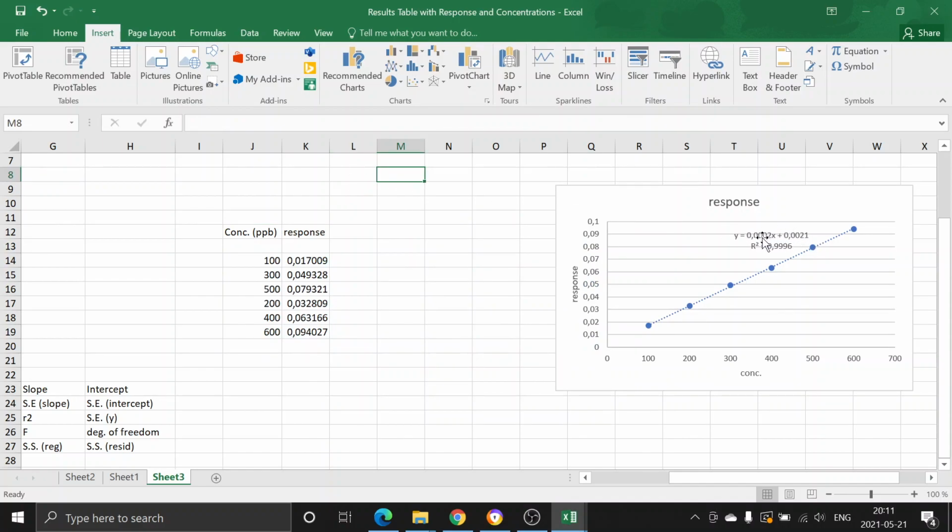and an equation is given to you, of course. You inserted a trend line, and a trend line equation is given to you by Microsoft Excel. And not all of you, but many of you use this slope value, 0.0002, to calculate the imidazole concentration in the extract. However, this is a rounded number. There are not enough significant figures in this equation, so it's an oversimplification.